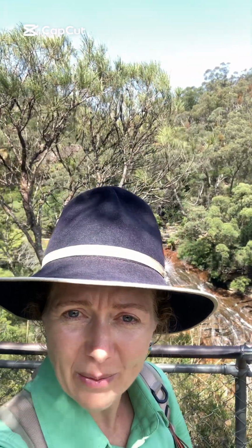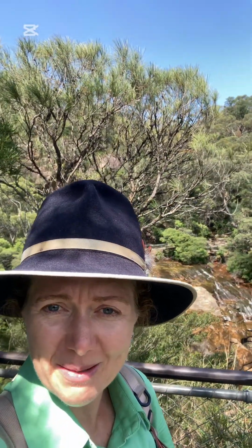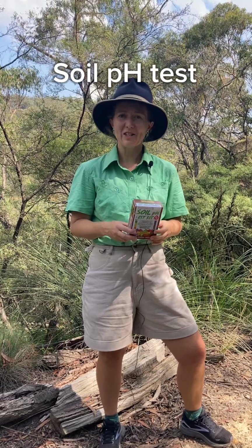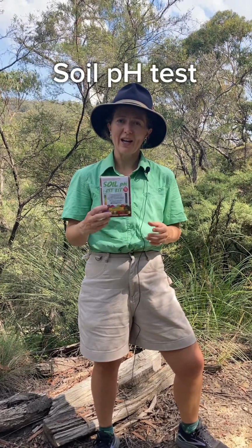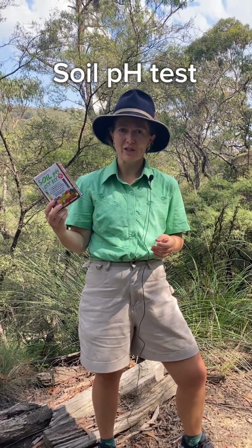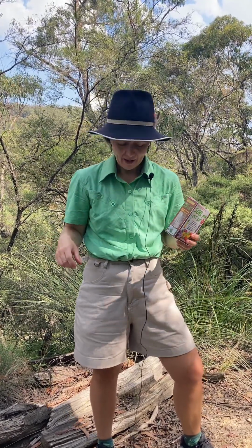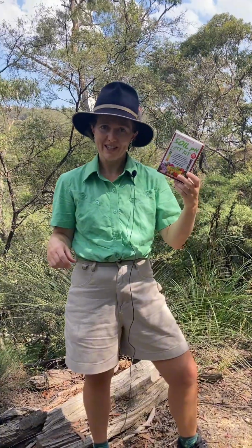We've almost made it round to Wentworth Falls and the creek just above the falls, and I will show you some fieldwork equipment and testing around there. In a sandstone environment, you can do a pH test of the soil, which has weathered from the bedrock in the area. The way I'm going to do that is by using this simple pH soil kit.